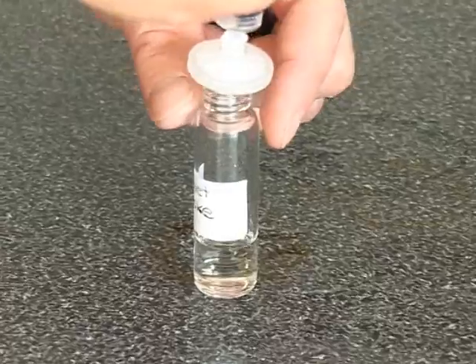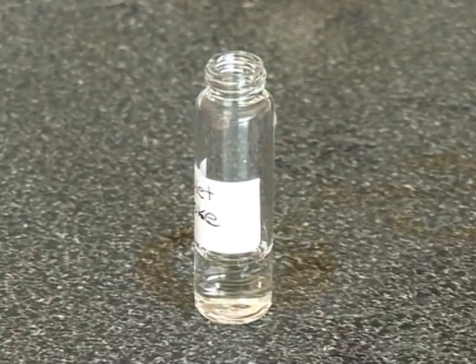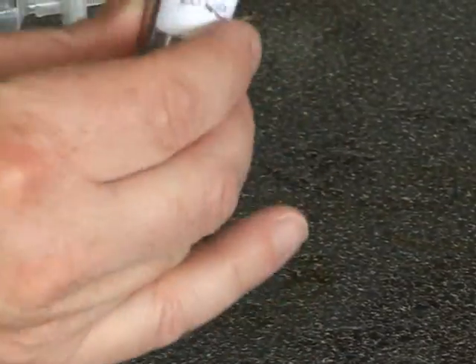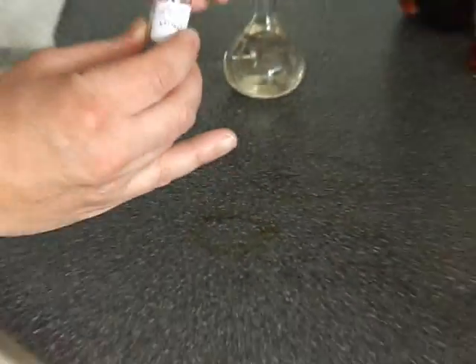The standard solutions and the samples are now ready to be analysed on the HPLC.